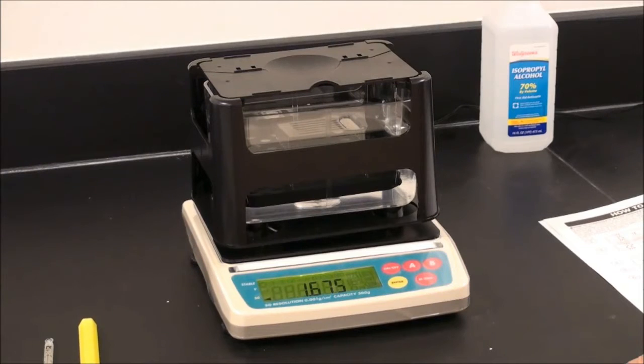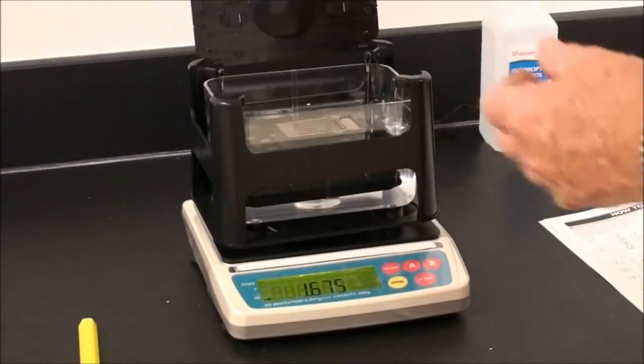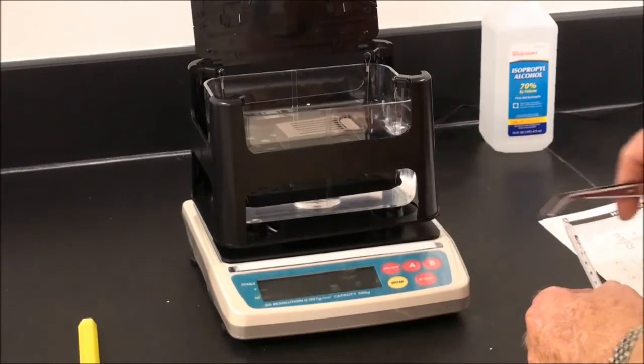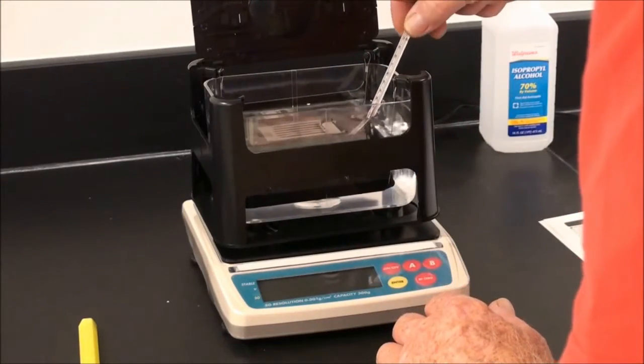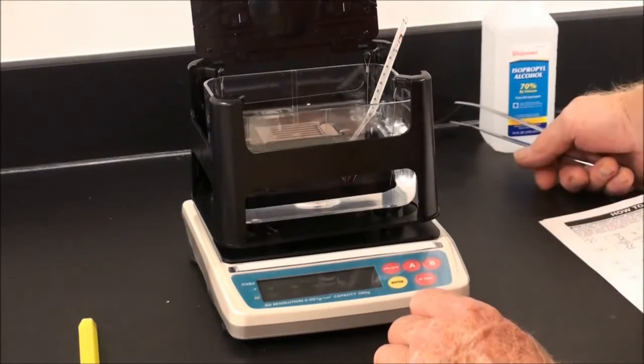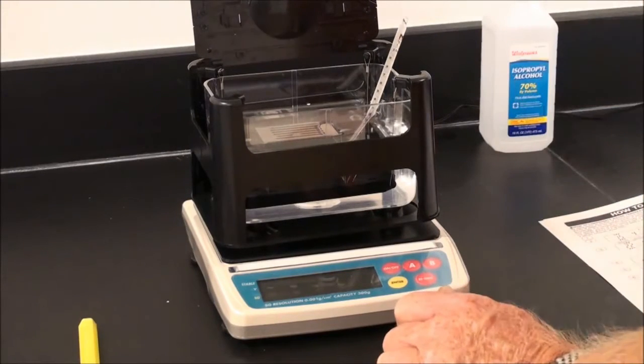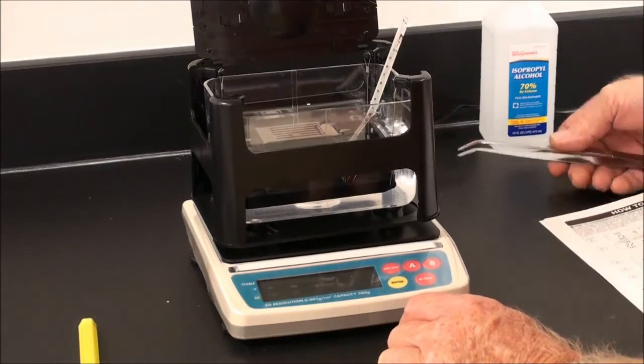Now, standard temperature is 4 degrees C, although most labs are not that standard temperature. So to compensate for this, you have supplied a precision thermometer. The instructions for using this is to remove the power, place the thermometer in the bath, and allow it to stabilize. This is set around 20 degrees, so we'll read 20 degrees C plus. Current temperature in here is 24 degrees C.